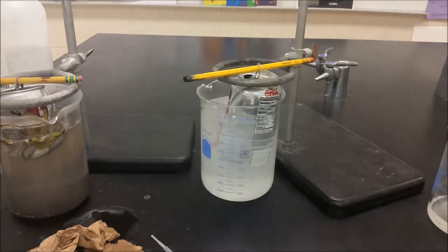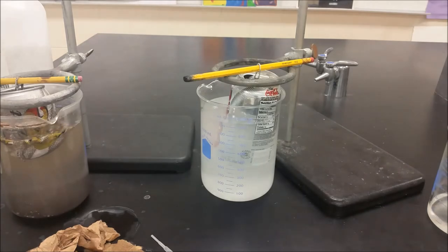There we go, and what's going to happen here is that hydroxide is going to facilitate a redox reaction where eventually the aluminum is going to get complexed by the hydroxide forming a solution.